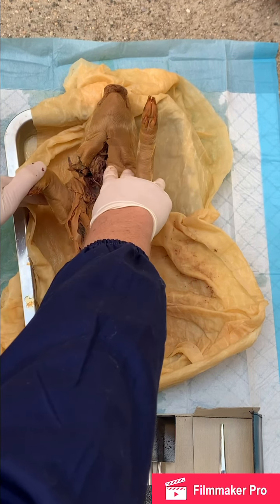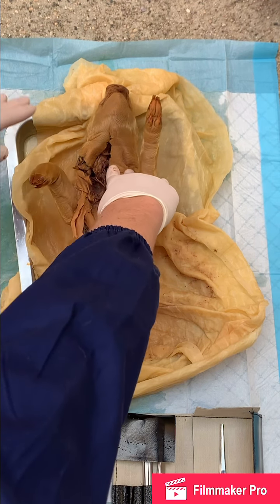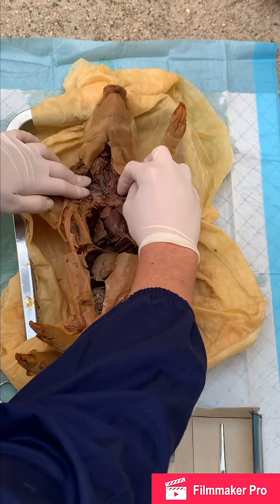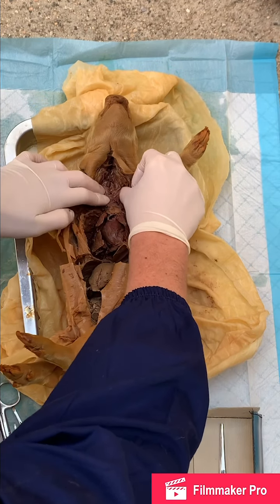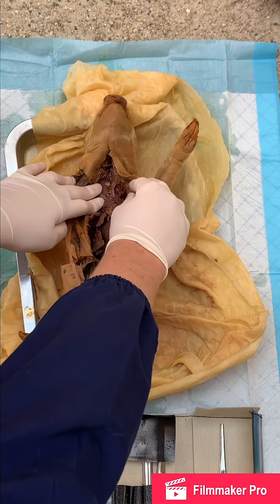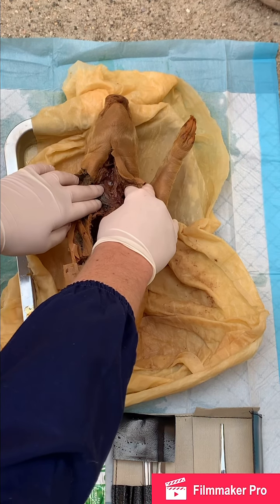The vocal cords work by vibrating to set out sound waves, and the greater the pressure of vibration, the louder the sound comes from. Next thing you want to find is the trachea. This is the trachea right here. This is what leads into the bronchi of the lungs. This is also known as your windpipe.